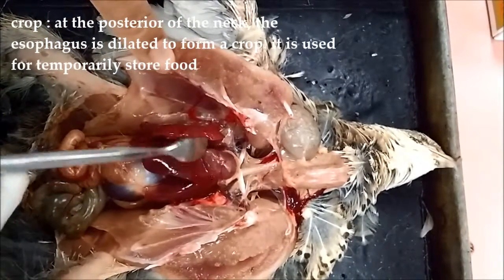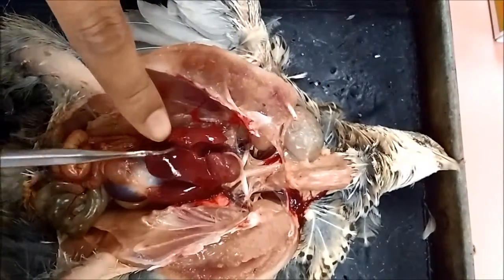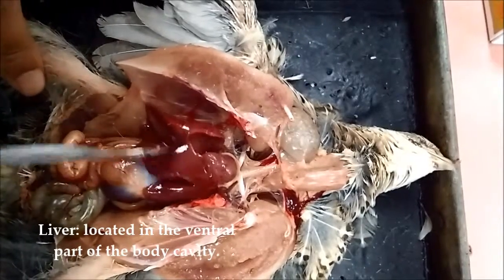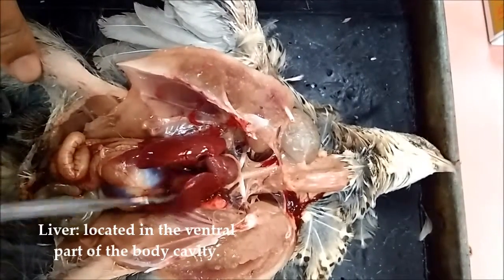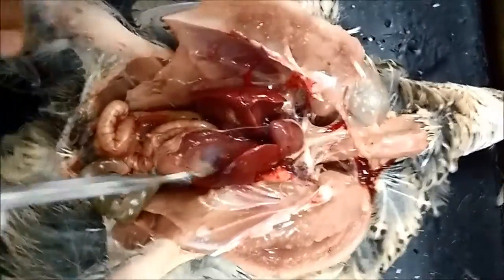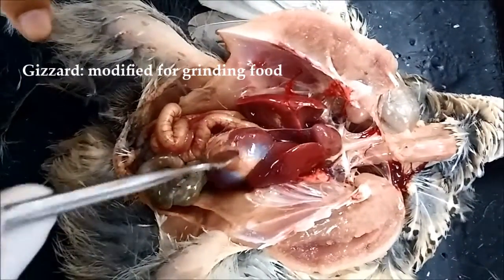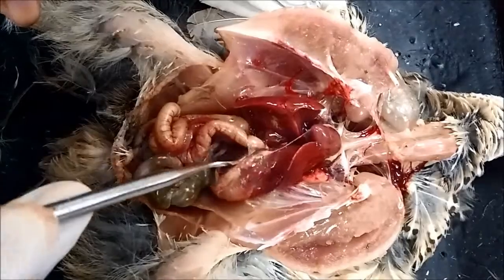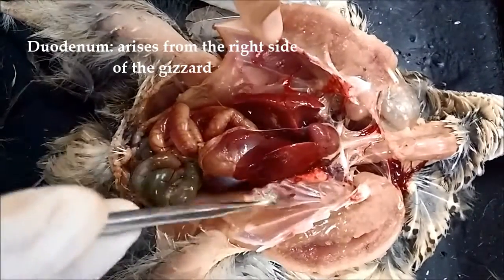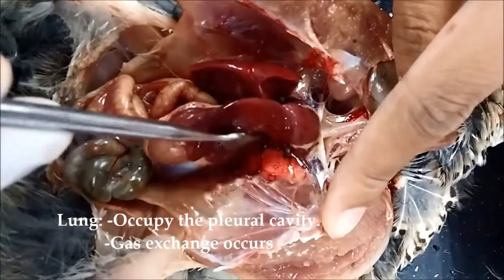Next, this is the heart. This one, and under the heart, this is the liver. They got like 2 chambers, 1 and 2. Okay, next, moving on. Under the liver, we call it the gizzard. And next to the gizzard, this is the duodenum. Okay. Oh, I forgot to show you the lung. So this is the lung behind here.